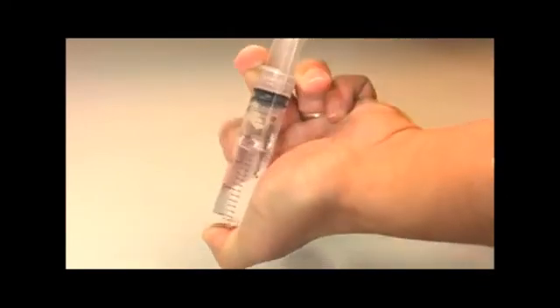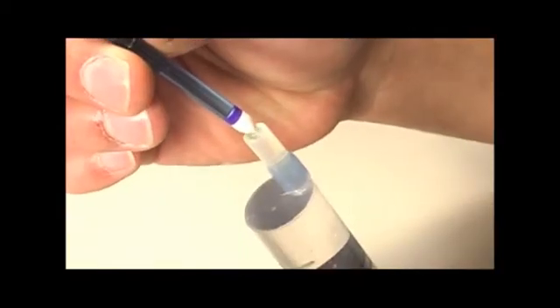Reapply vacuum several times until no more air bubbles form. Holding the syringe vertically, push out all the air so that a dome of water covers the tip. Insert the tensiometer into this dome.